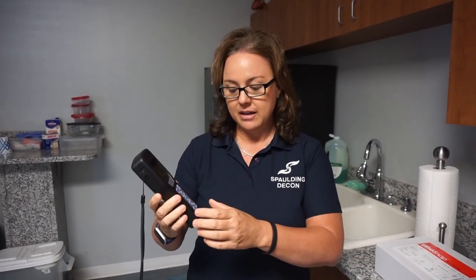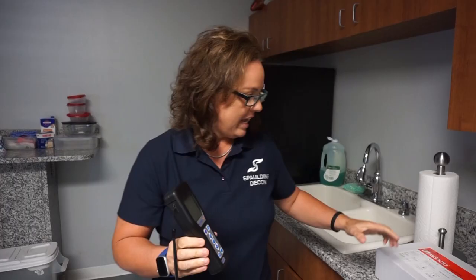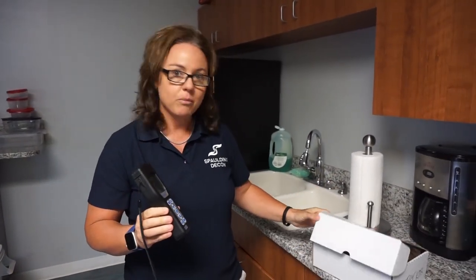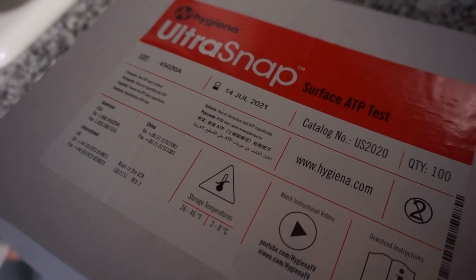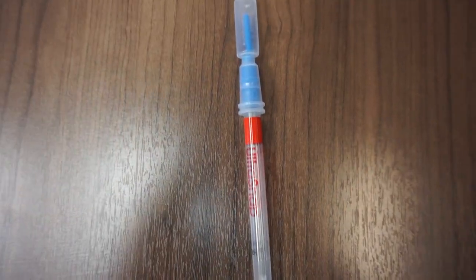I'm going to show you how to properly use our new ATP testing. This is used to calculate bacteria counts on different surfaces. The quantities of bacteria are going to vary, and there are great videos on YouTube under this brand — it's SystemSURE Plus. You buy the test kits and these stay refrigerated, but they have a very long shelf life; this one is July 14th of 2021, so it's about a year shelf life.